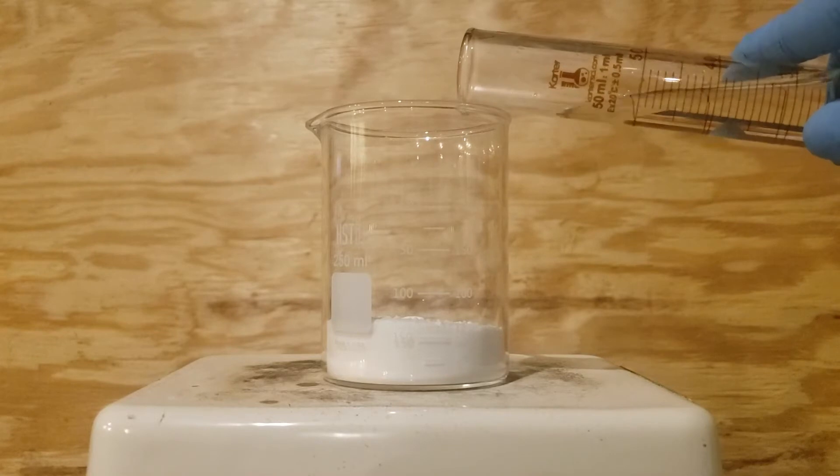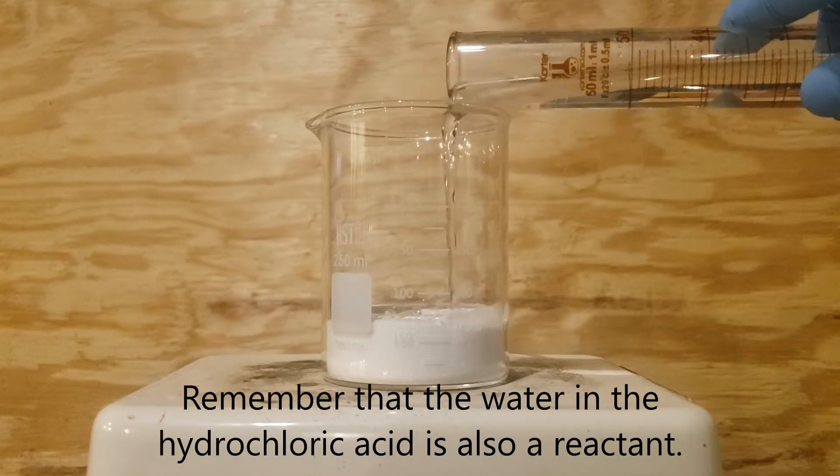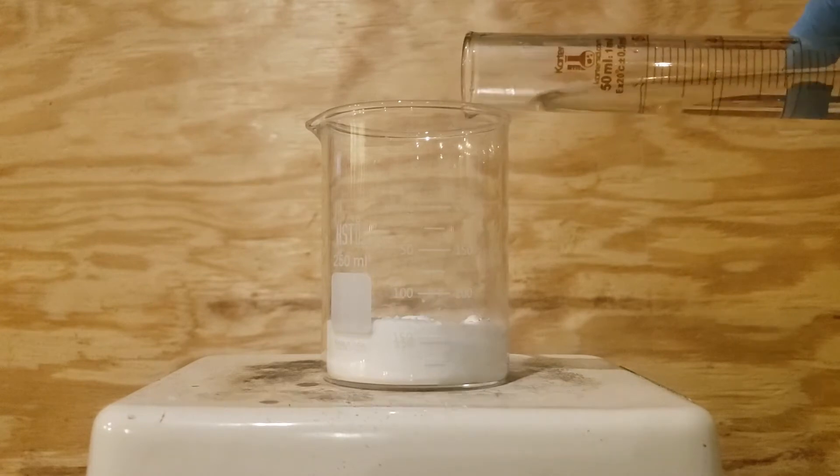I then slowly began addition of the hydrochloric acid. However, nothing really happened, so I just decided to dump in the rest.